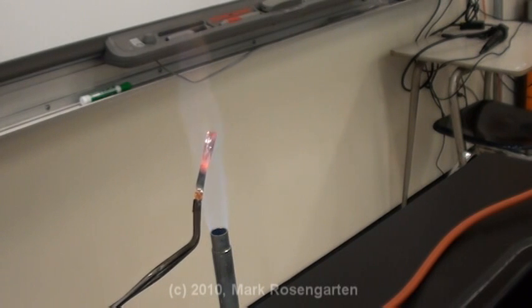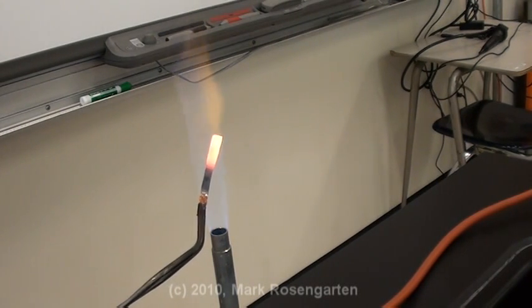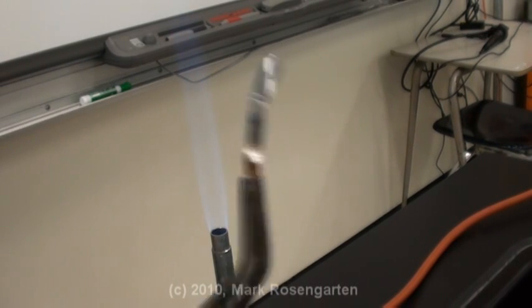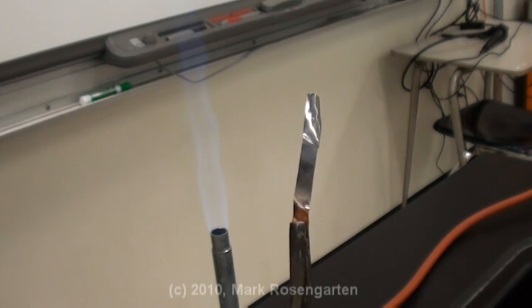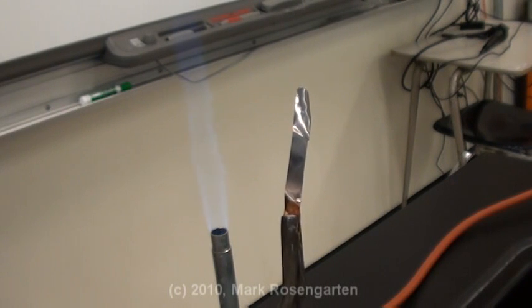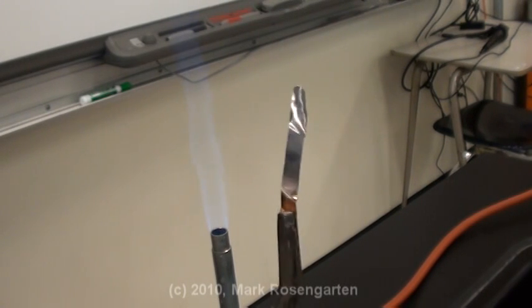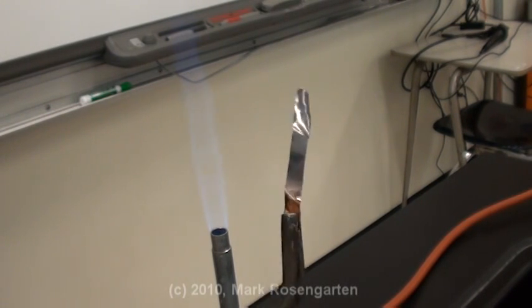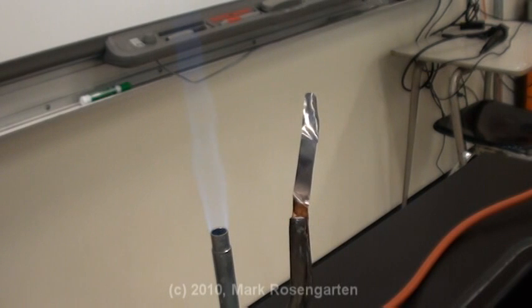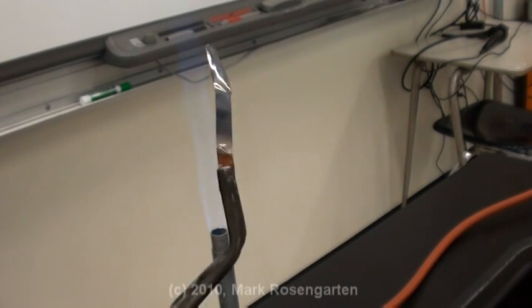As it heats up, you can see how it glows. When we're done, you can see that what was once copper colored is now sort of a silvery gray color. This is the copper oxide that we just formed in the heat of the Bunsen burner flame. Copper was oxidized. The oxygen from the atmosphere was reduced, leading to copper oxide.